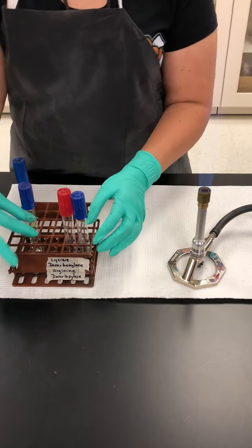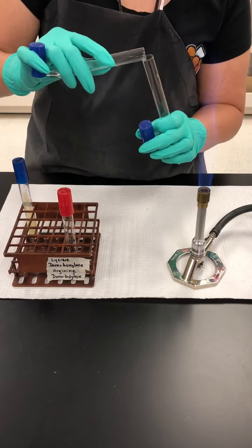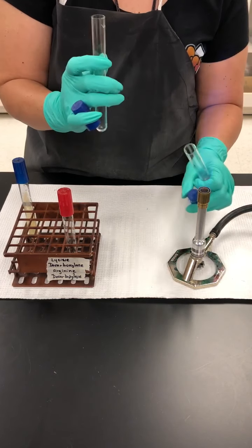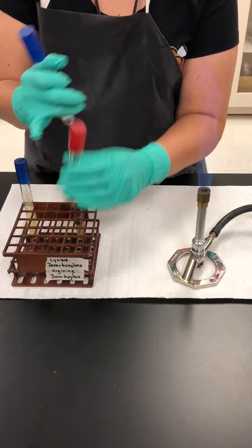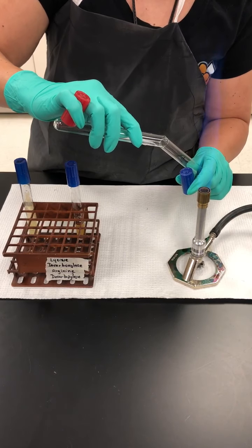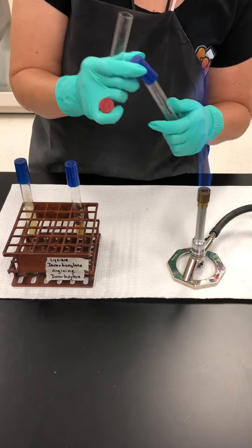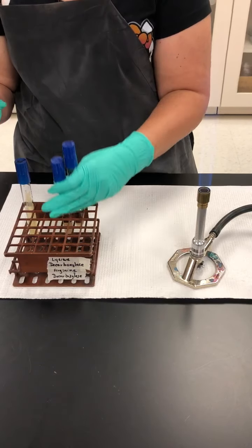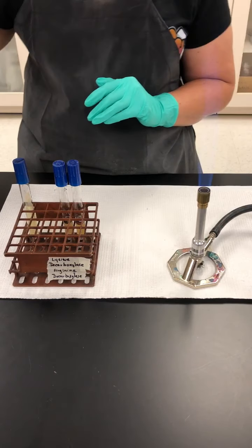The way we're going to do this is very simple. We're just going to open the tubes. I'm going to place some mineral oil on top. Notice that I'm working close to the flame because that is the area of work where all that hot air is. And the tubes are ready to be incubated for 48 hours at 37 degrees. I'm going to be looking for a color change.